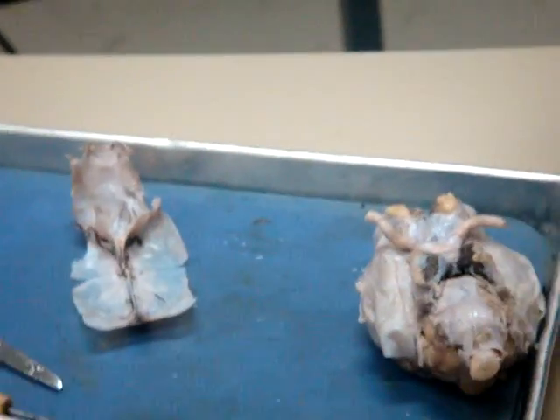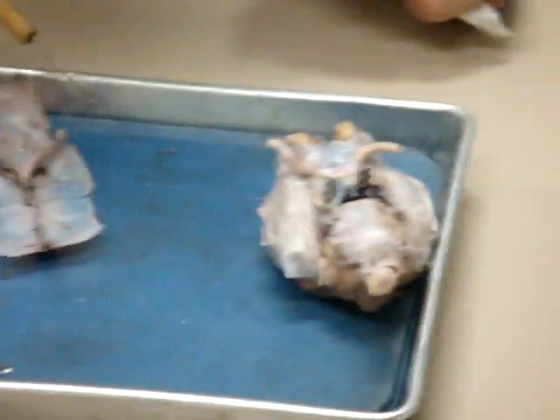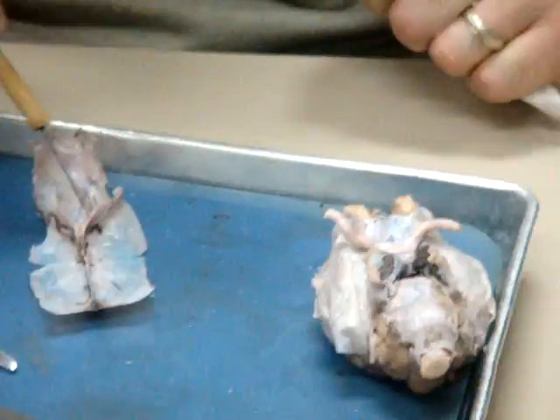So you can really see the thickened walls of dura there between where the cerebellum is and where the hemispheres would be. Okay, so this, and I cut it a little bit tight, but this would be a thick wall coming this way, sort of a triangular shape, like a tent shape.